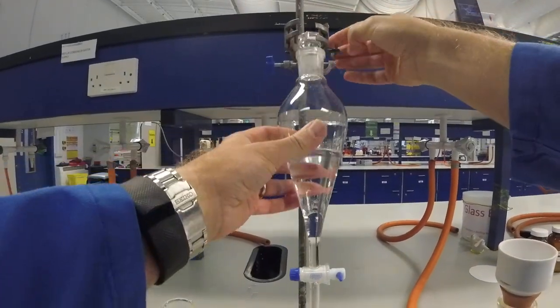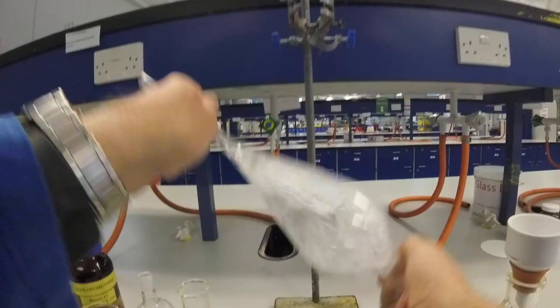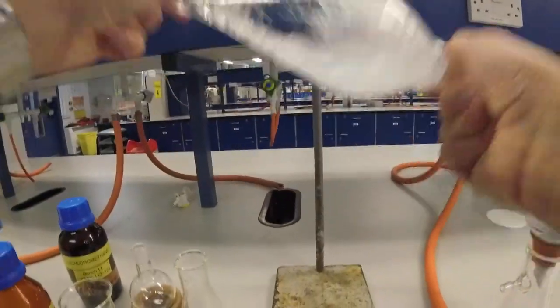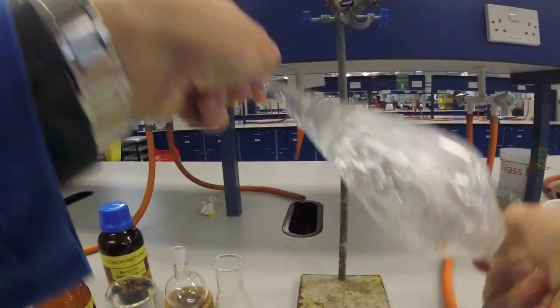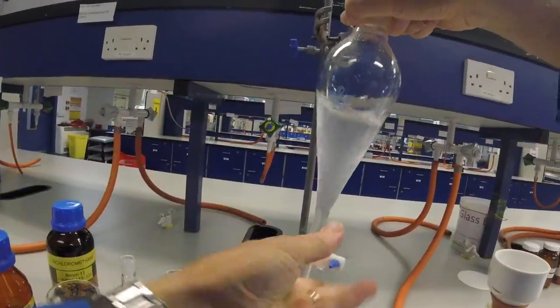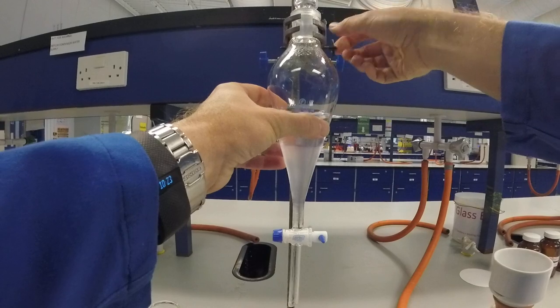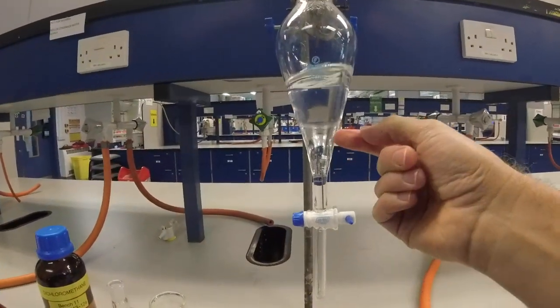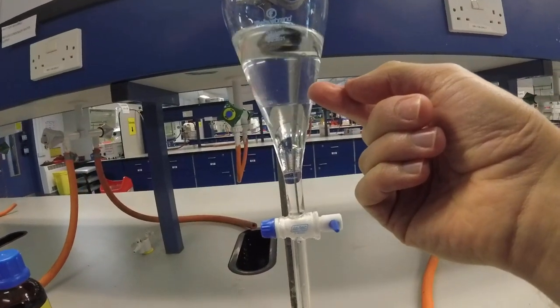Stopper in again. Release. And give it a really good mix. Those layers are really well mixed. Clamp and remove the stopper. And then you can see those layers starting to separate.